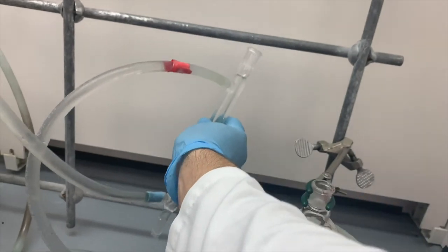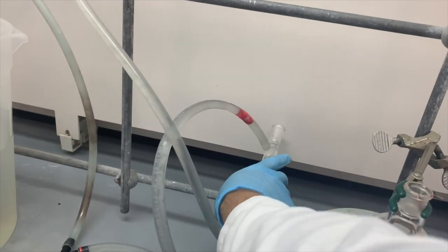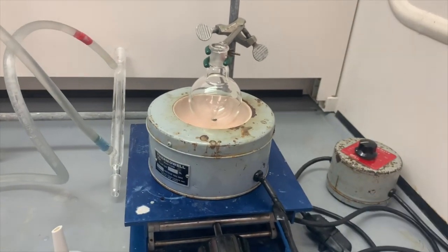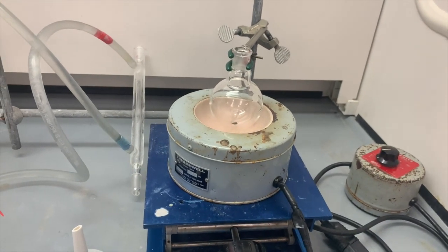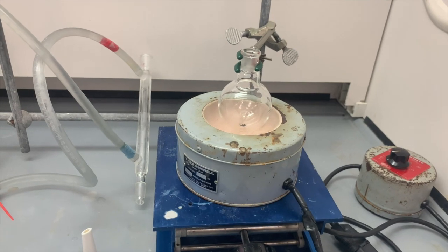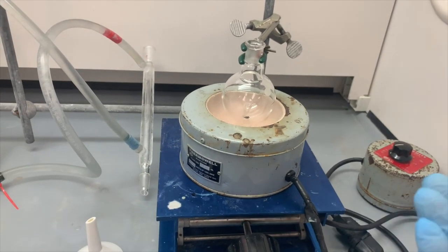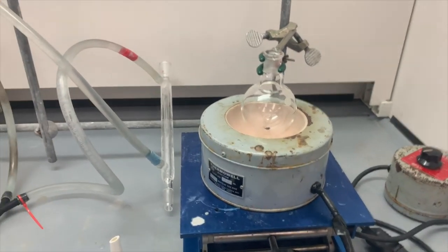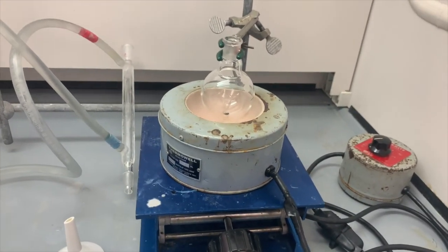We need to add our ingredients, our reagents, to this mixture. I like to use the word ingredients because I like to think of running an organic chemical reaction as cooking, except you just don't eat what you get. You don't eat the product. You view it and you admire the product, but you don't eat it.